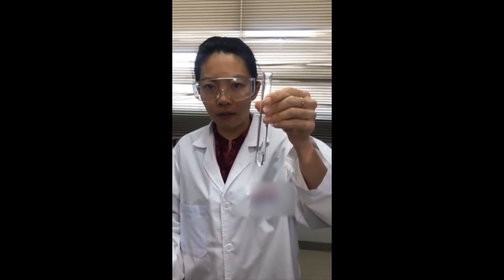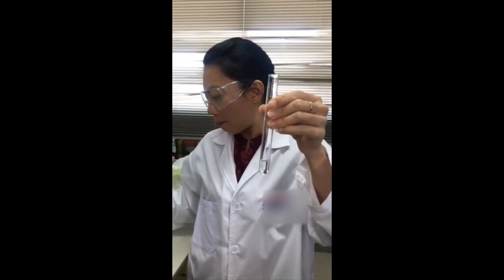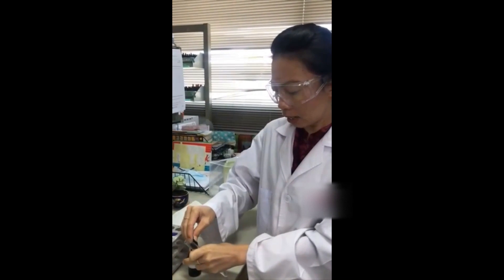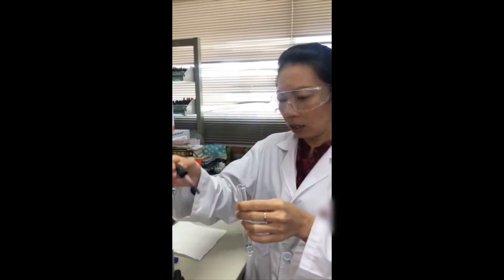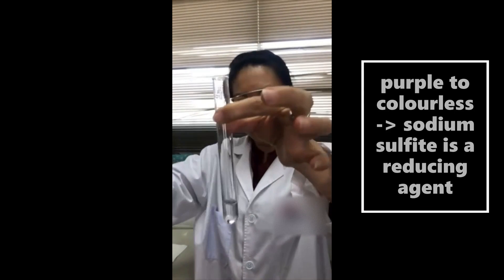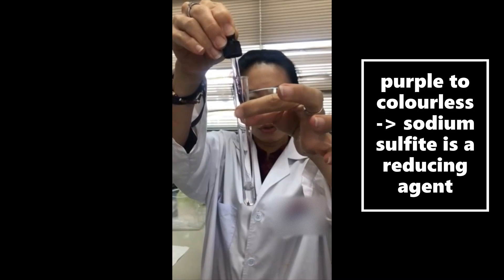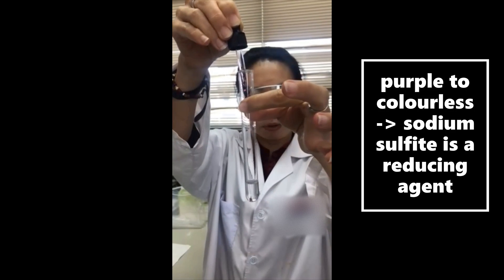For test two, we mix sodium sulfite with acidified potassium manganate 7 to see if the sulfite ion is a reducing agent. Let's see if the potassium manganate color gets decolorized. As you can see when I add this purple solution, you no longer see the purple color.